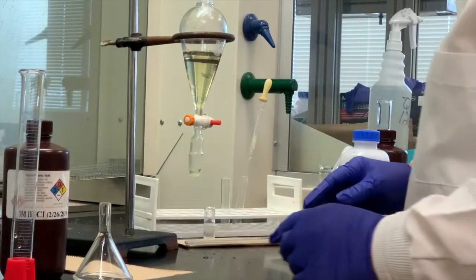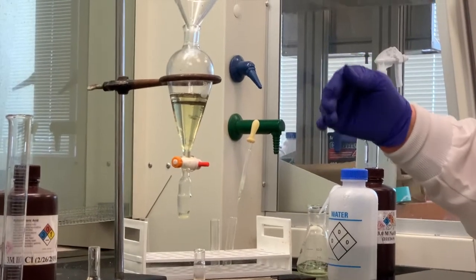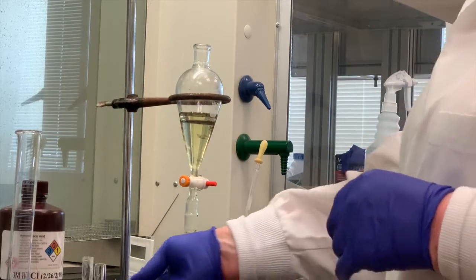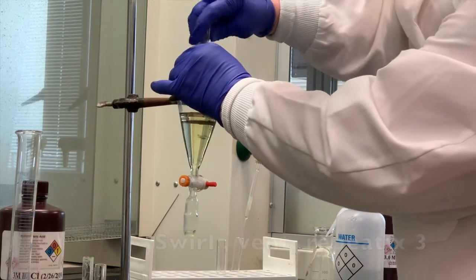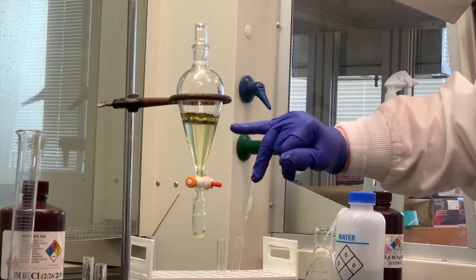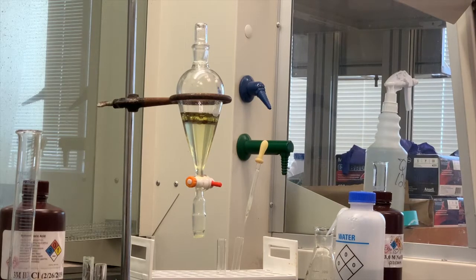But if you are doing an extraction and you add something to it and you don't see 2 layers, then you need to think, oh wait a minute, I've got the wrong layer in there. You should see 2 layers. I'm going to do the same thing that we did before, and give it a minute or so just to have time to separate the layers. Although you can see that the layers are separated fairly well, we still have that material that we see.